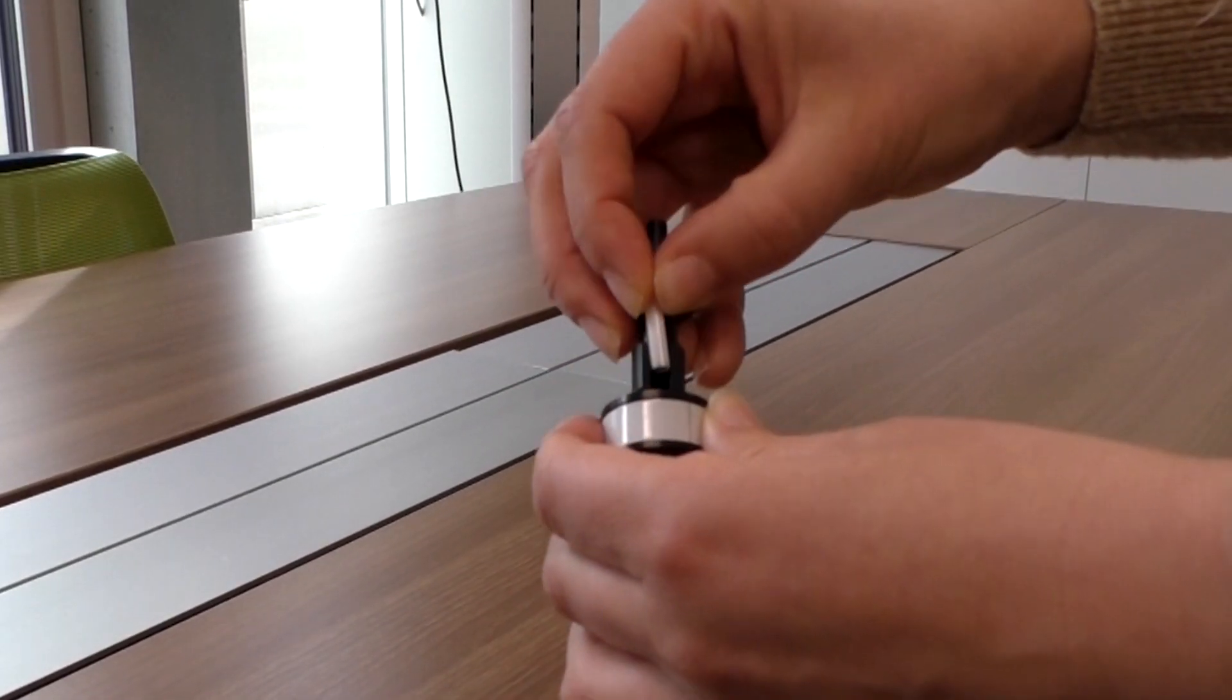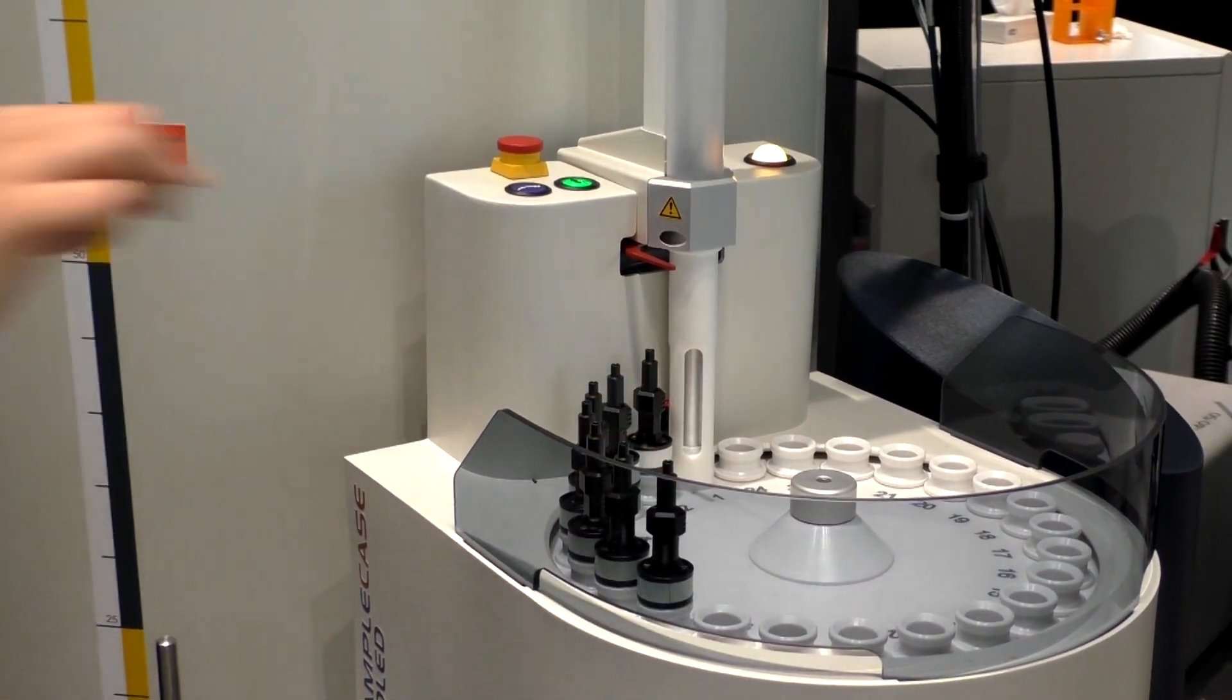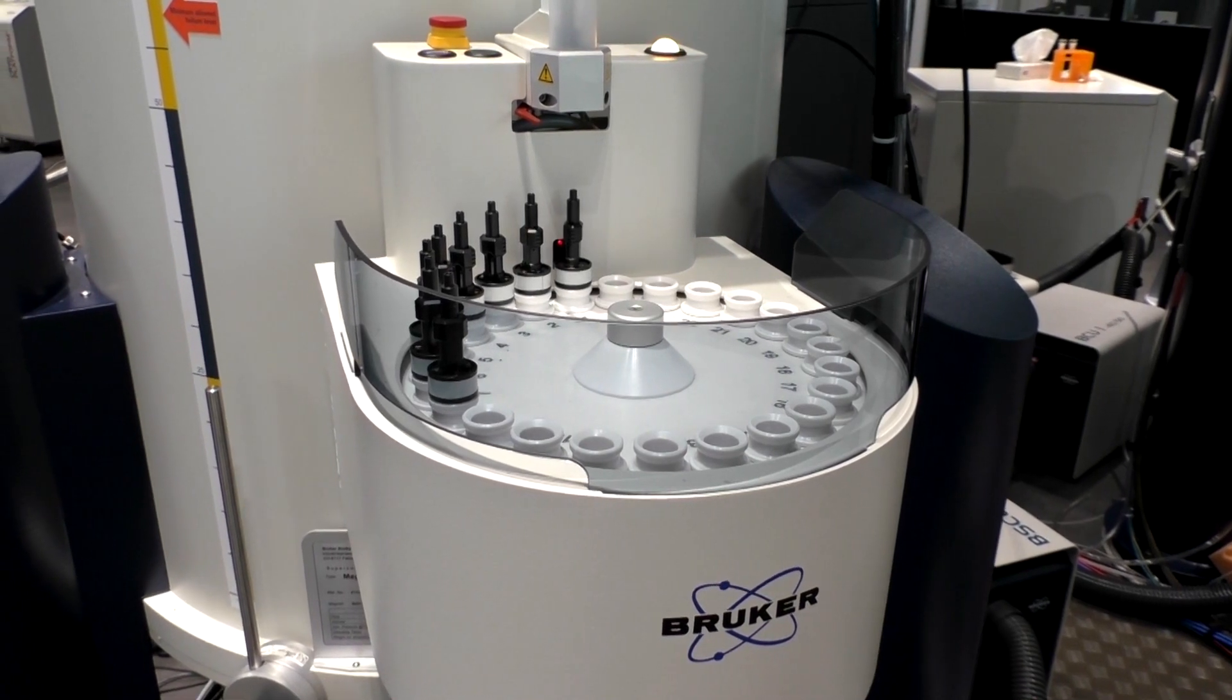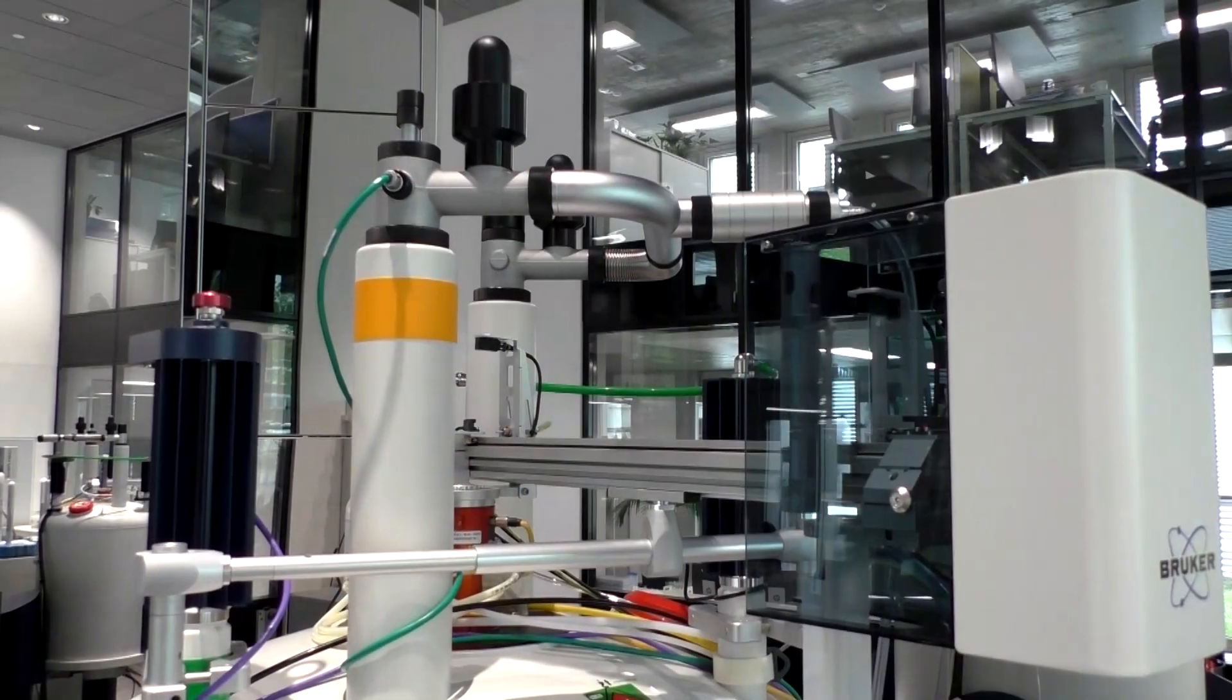Slide the rotor into the shuttle and place it in the sample case. The shuttle carries the rotor into and out of the magnet using well-proven transport technology known from liquid state NMR.